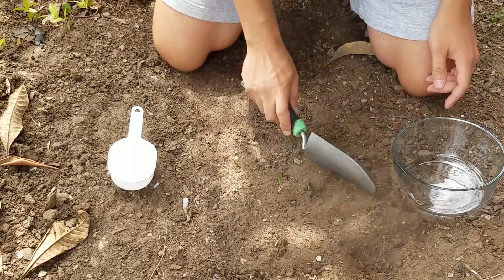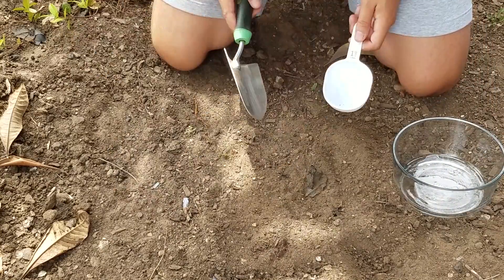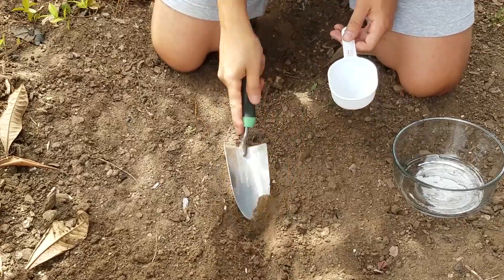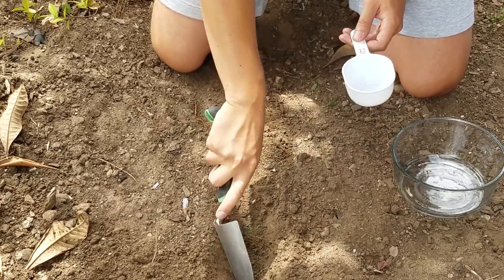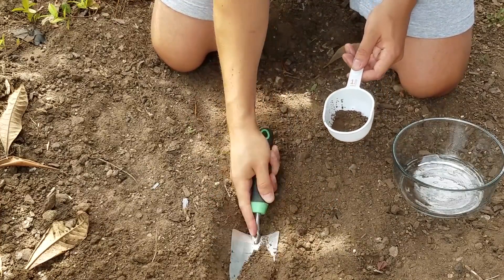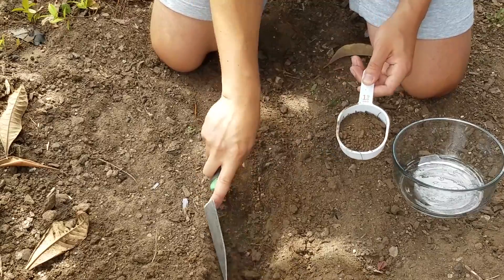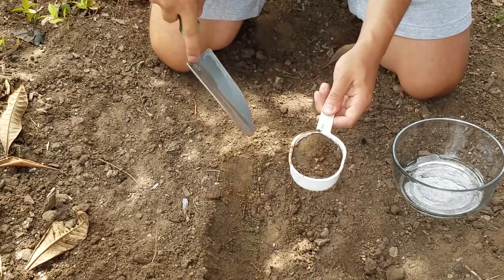When we're digging out here, we want to make sure we get down below the surface — anywhere from two to four inches down is a good idea. With the Rapitest kit I need about a cup of soil, so we're going to go ahead and dig down, cut a little trench, and get a good sample. Let's get that out of there and scrape it up.